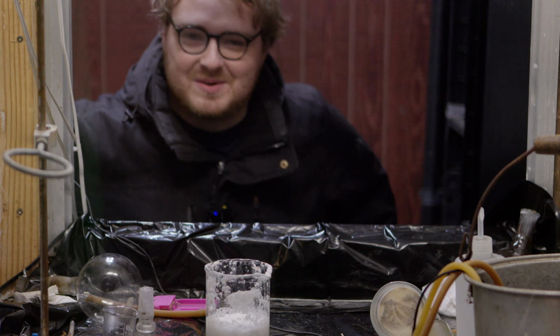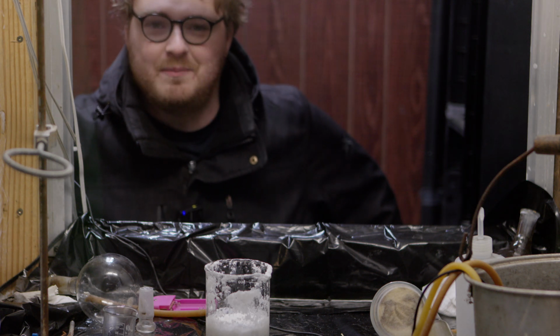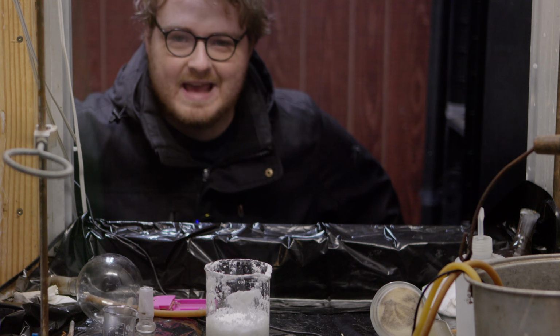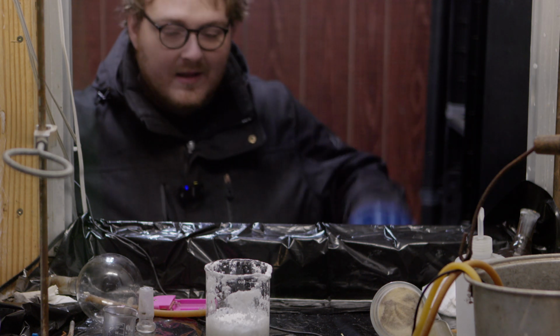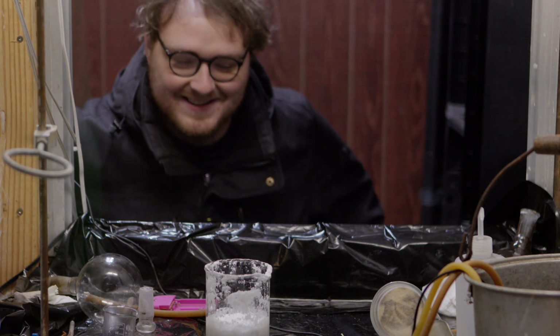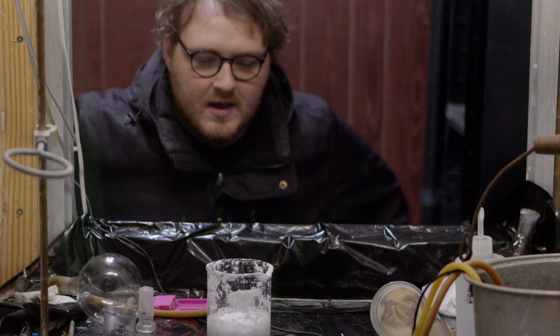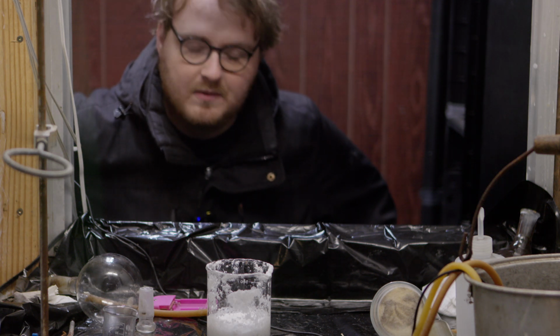Normally the precipitate just sort of forms there, but I think because I added so much of a very strong base to a really strong acid, it started boiling or producing a lot of gas. Also, hydrogen chloride produces gas by itself. Not entirely sure, but it's very fluffy and very interesting. So the next step, we're going to filter off the benzoic acid, which has fallen out of solution, and then we're going to dry it.